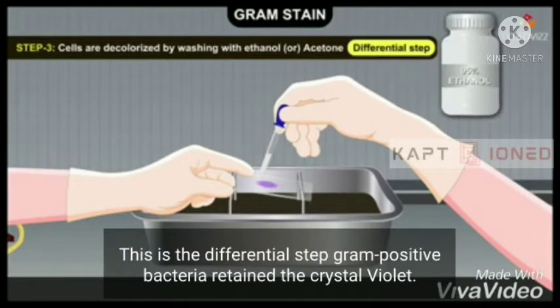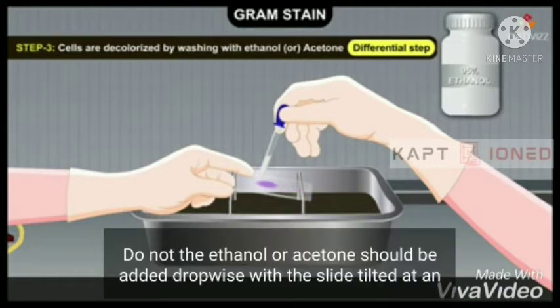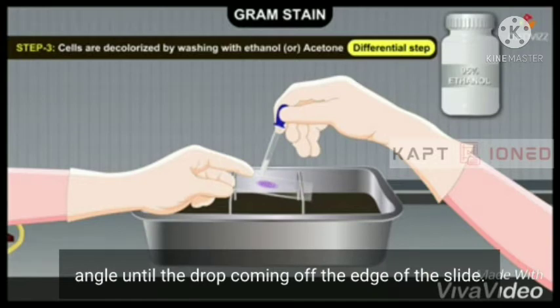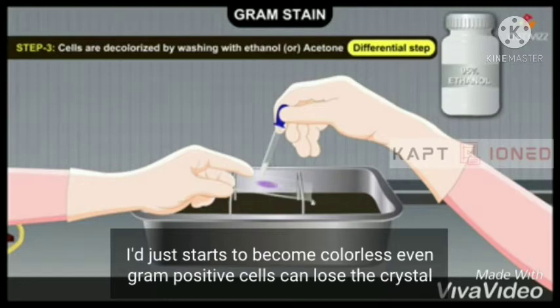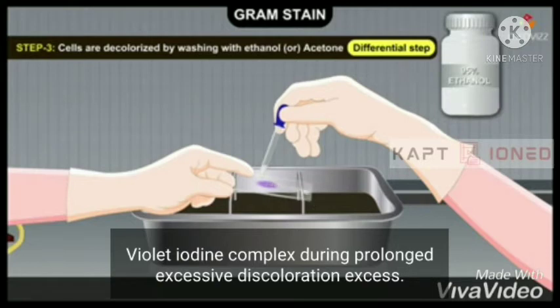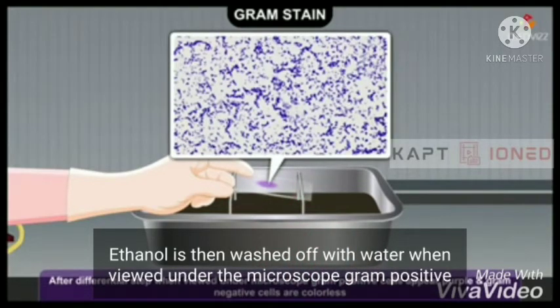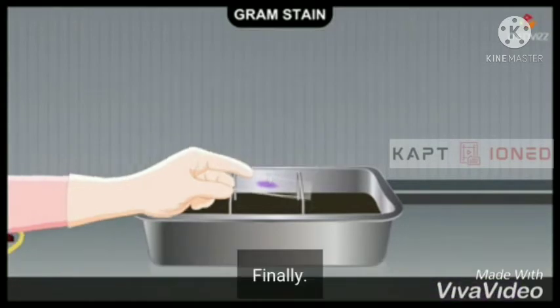Gram-positive bacteria retain the crystal violet, whereas Gram-negative bacteria do not. The ethanol or acetone should be added drop-wise with the slide tilted at an angle, until the drop coming off the edge of the slide just starts to become colorless. Even Gram-positive cells can lose the crystal violet-iodine complex during prolonged excessive decolorization. Excess ethanol is then washed off with water. When viewed under the microscope, Gram-positive cells appear purple and Gram-negative cells are colorless.